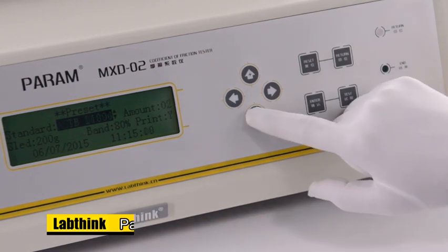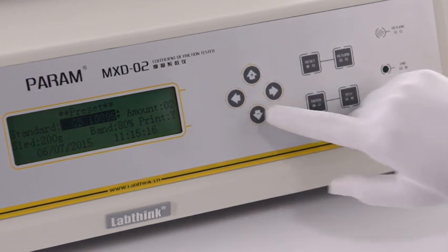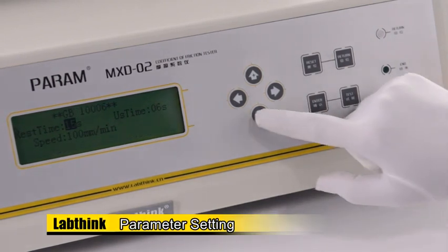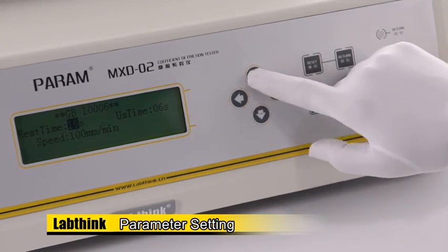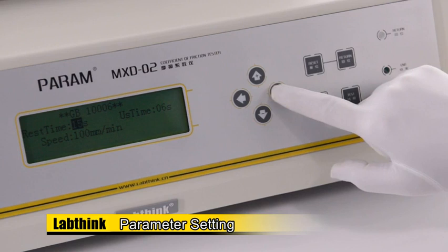Press the left and right arrow keys to move the cursor to Standard and select Standard GB 10006. Press Enter to set parameters. Set rest time as 15 seconds, which is the time when the sled keeps still on the specimen. Press Enter to save the setting. Set US time as 6 seconds.